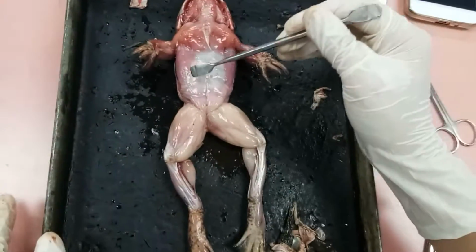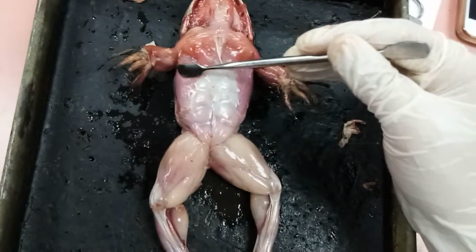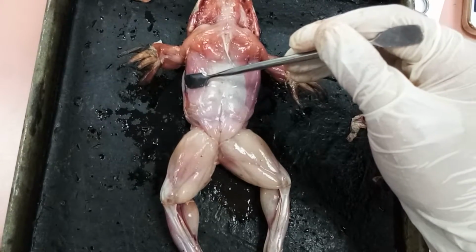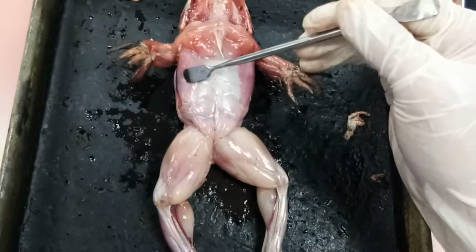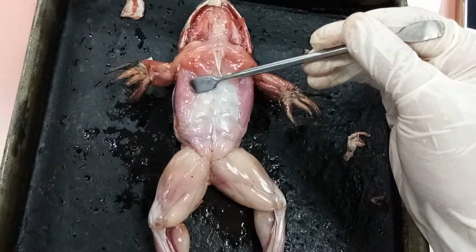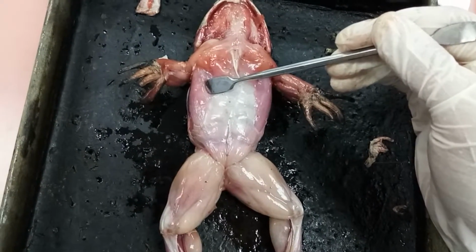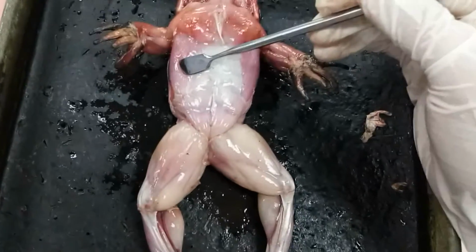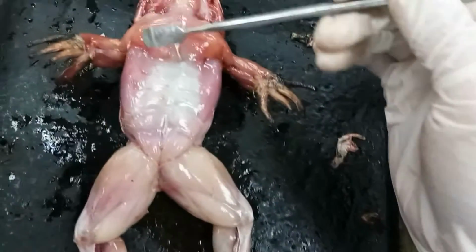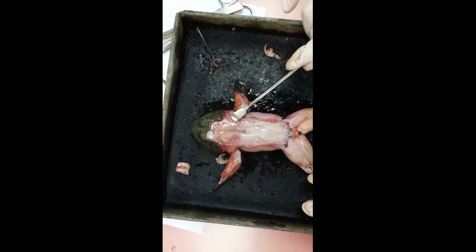And this is the external oblique. It is made up of a thin sheet of posterior ventrally extending fibers on either side of the body. Its origin is the dorsal fascia. Its insertion is the linea alba, dorsal to the rectus abdominis, and its action is to compress the abdomen and aid in expelling air from the lungs.